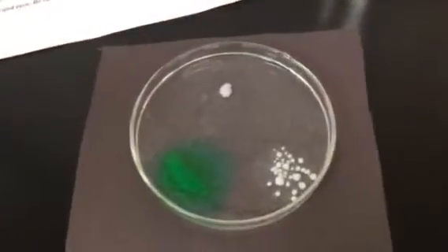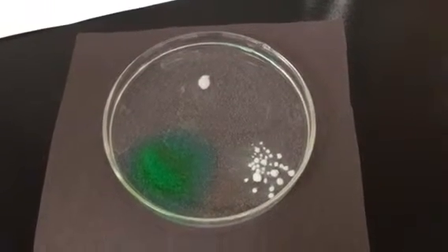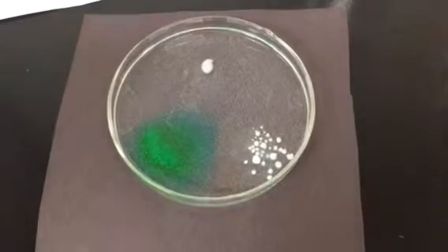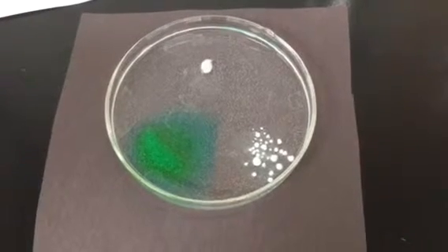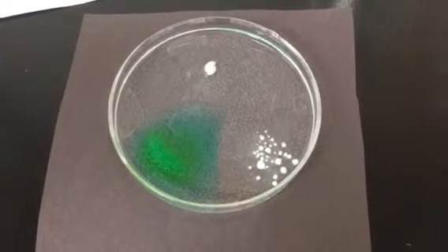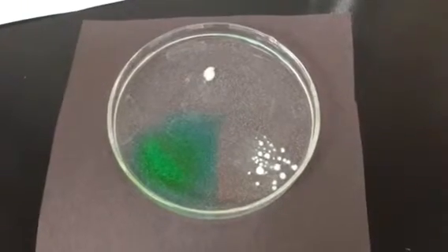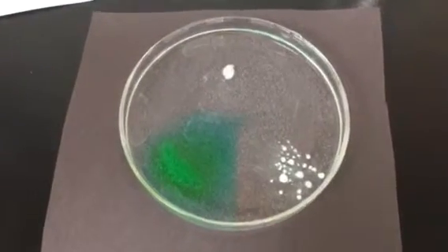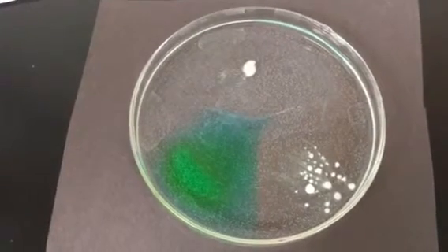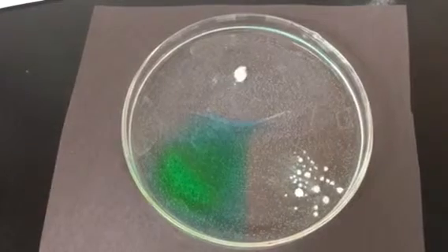Once again, you see the calcium and copper salts dissolving, especially the copper. You can see it's dissolving and starting to spread. Let's look at what's going to happen. The sodium hydroxide is also dissolving, along with the calcium chloride. What you're going to try to figure out is what new compounds are forming here.